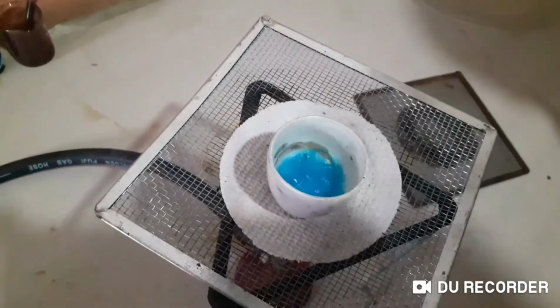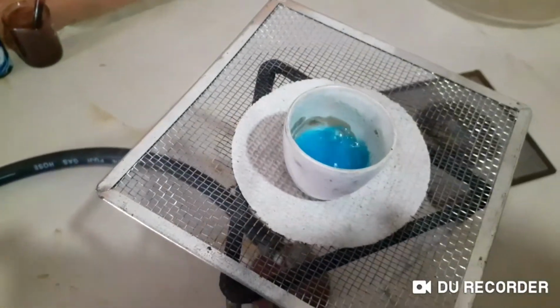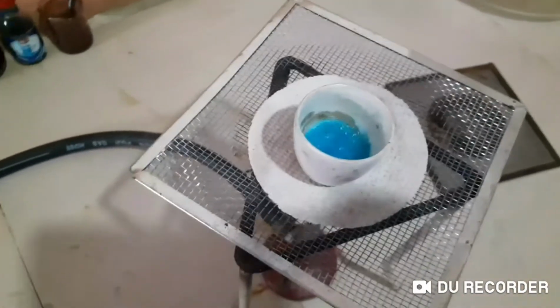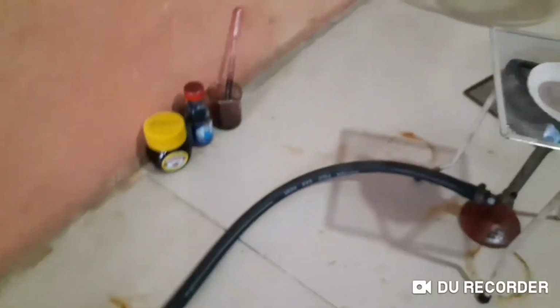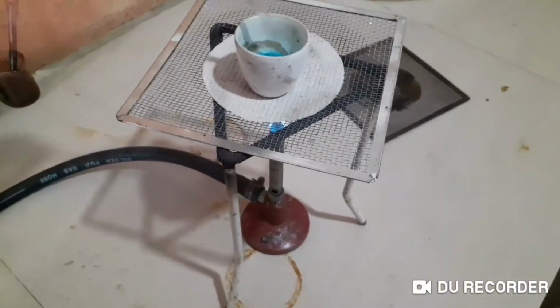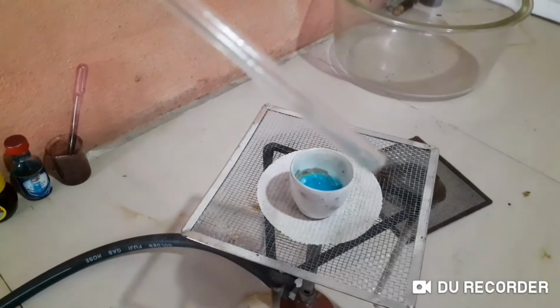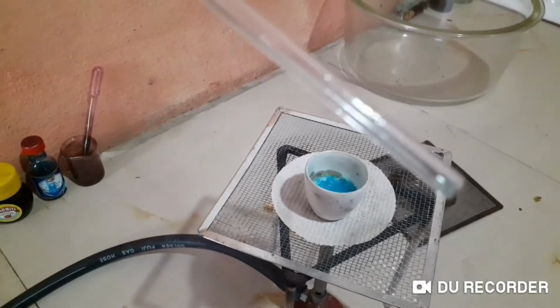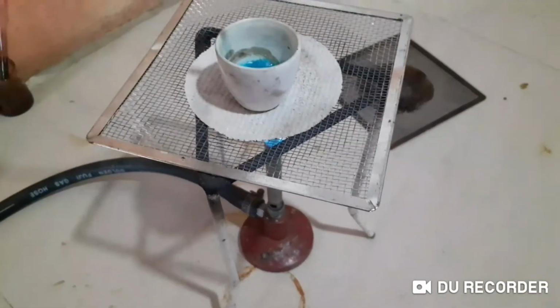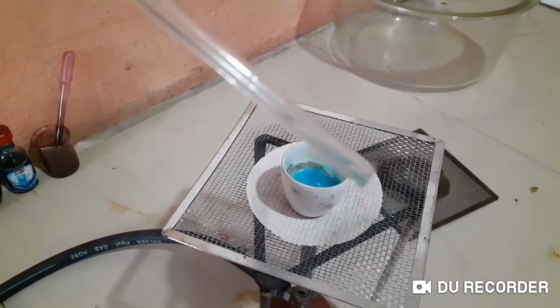Oh, children, this is actually now heating. Let's see whether this is crystallizing. Can I have the glass rod? How do you check that here? We take a glass rod, and how do you see that? Move away now for a little bit, I let the others see as well. You can take a little bit out and see whether it crystallizes. Sorry, it doesn't crystallize here, right? It's not thick yet. We have to heat it until it gets thicker.